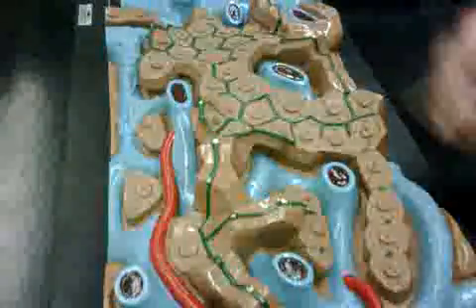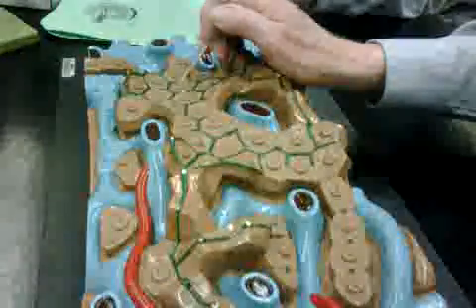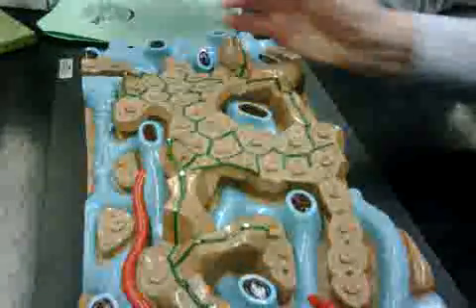Right? And those sinuses are lined. Is this the same as the rough texture here? No. No, these are actual hepatic cells, liver cells. This is the nucleus, cytoplasm of the liver cells.